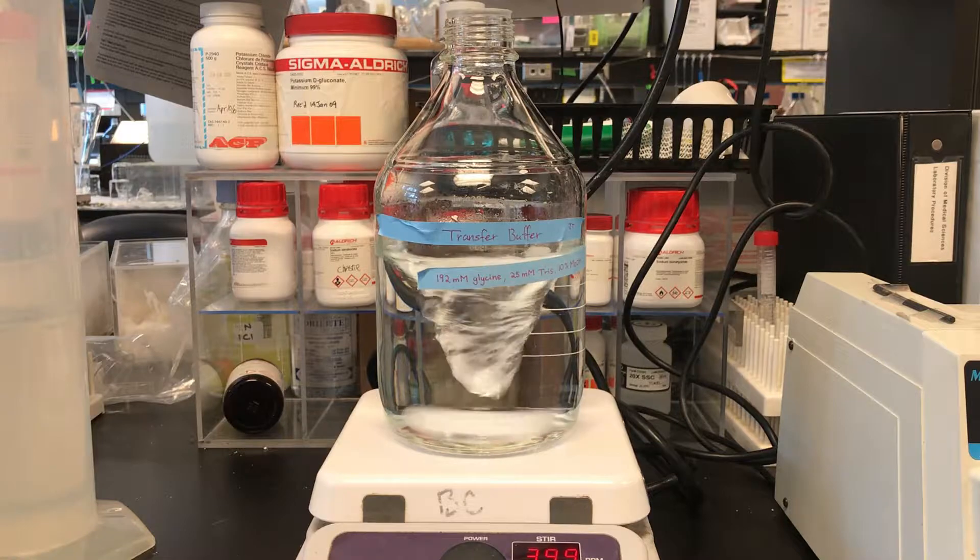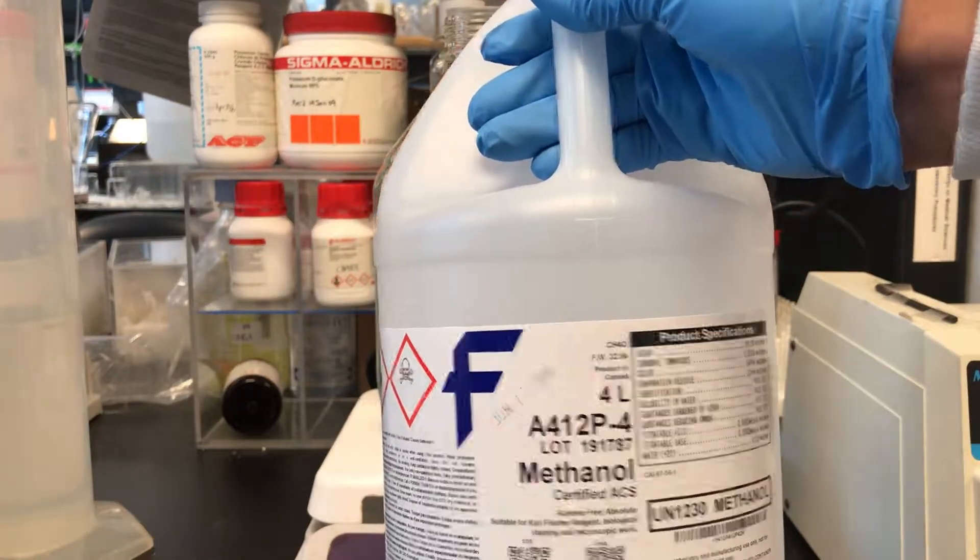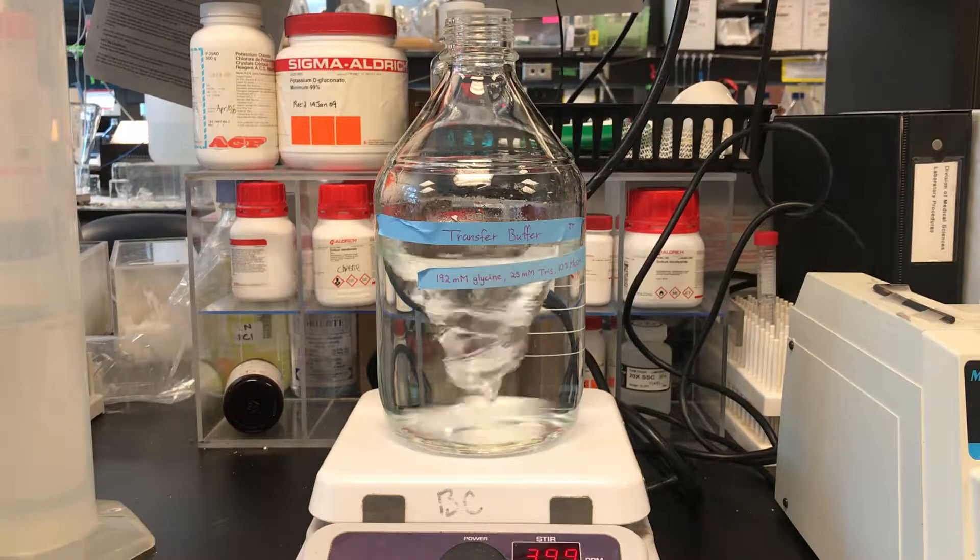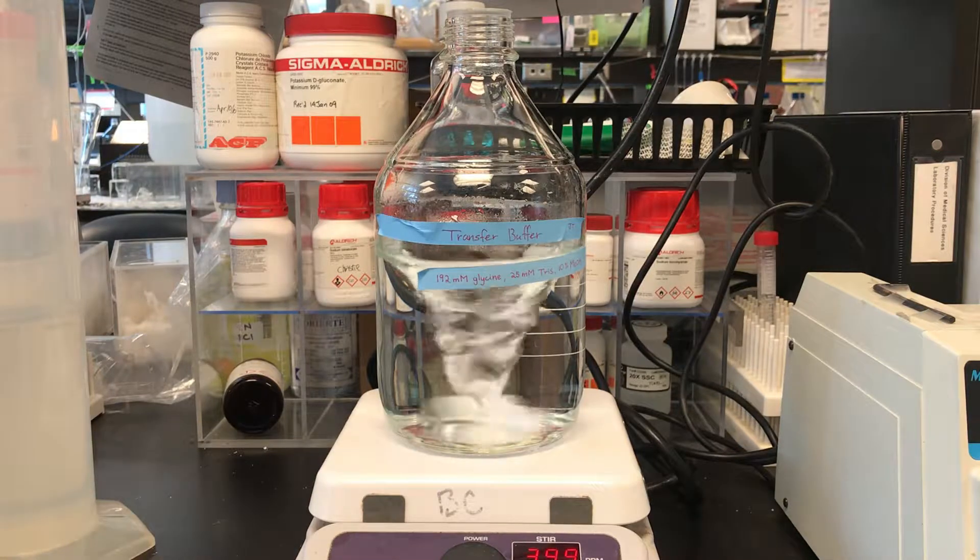While spinning, add 200ml of methanol into buffer bottle.